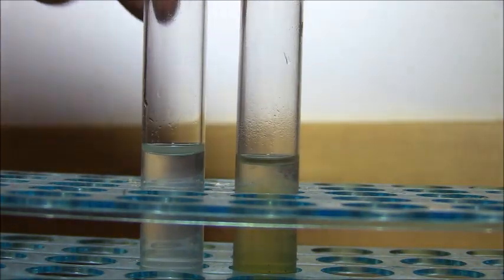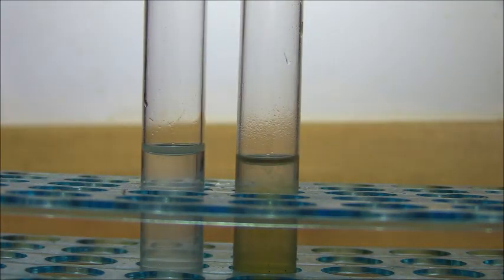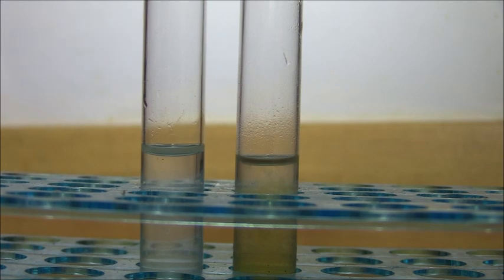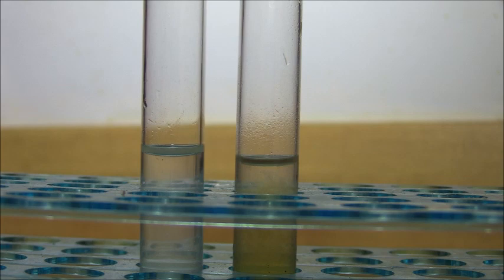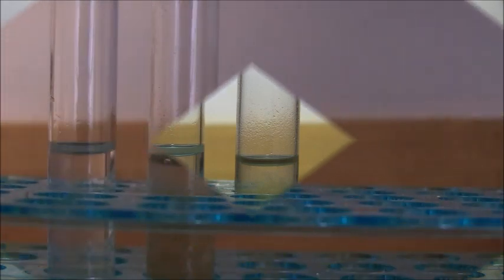So I'm going to let this sit for a few minutes and I'm hoping that that precipitate will settle out to the bottom so that we can quantitatively estimate how much precipitate we've produced.